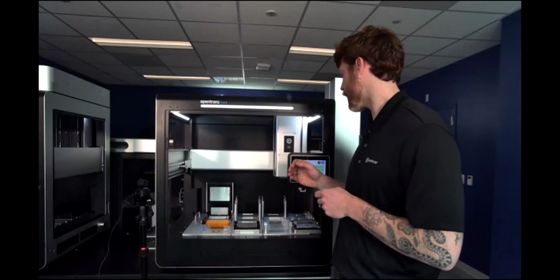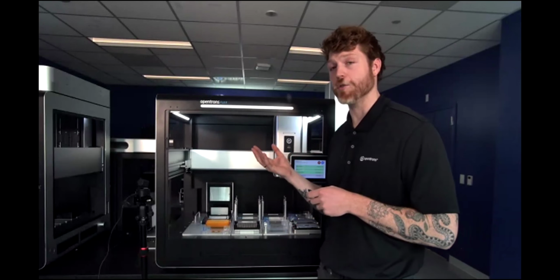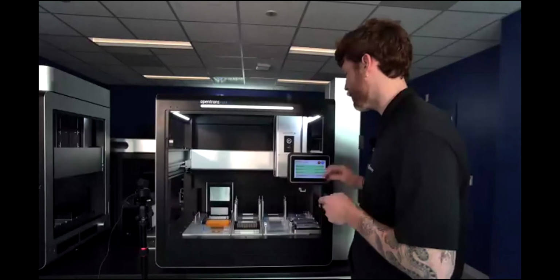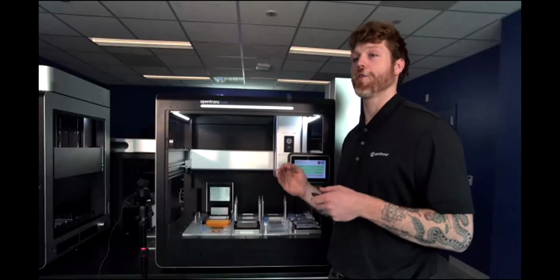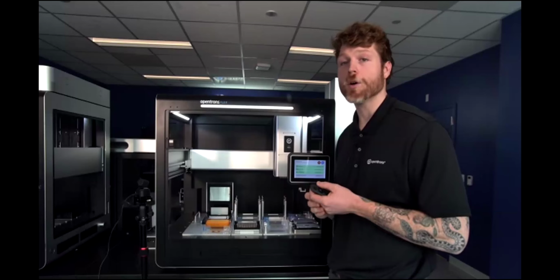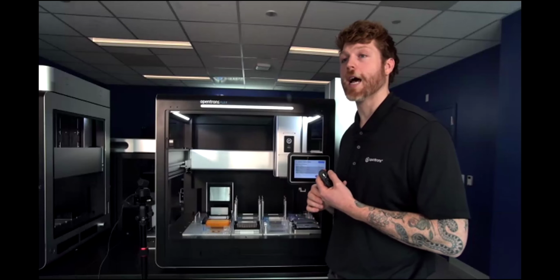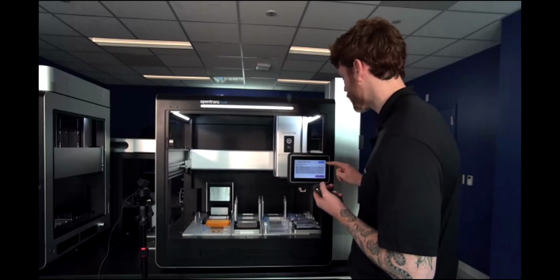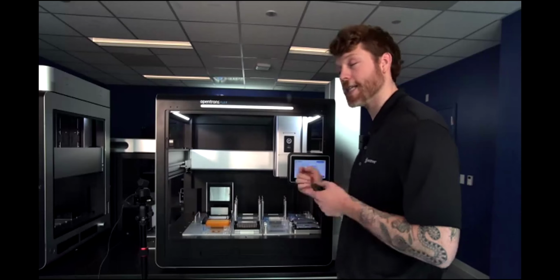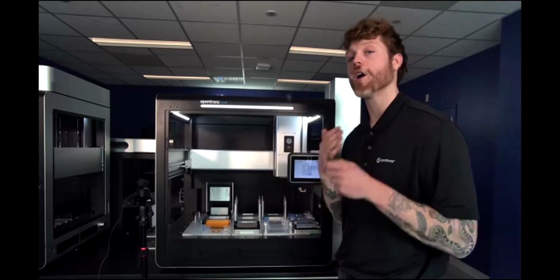And if you are an end user who has the HEPA UV unit and are concerned about the UV, as these are bolted onto the side of the instrument here, fear not. We have made it so that there's a retrofit kit available for any Flex that's out in the field, which is going to allow for connection points within the Flex windows that will identify when all of these stackers, as well as the front door, are all shut.